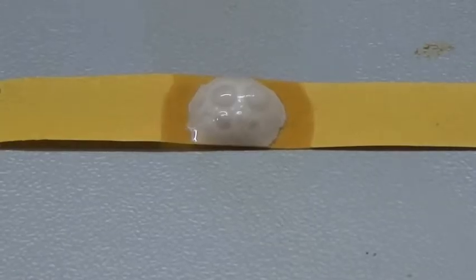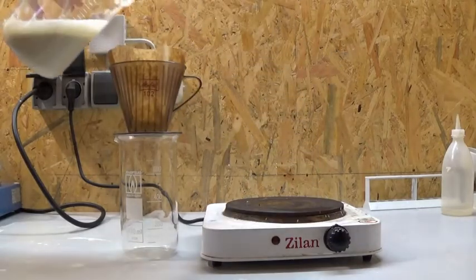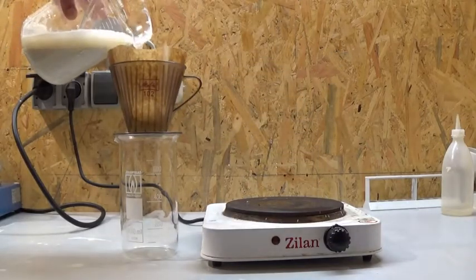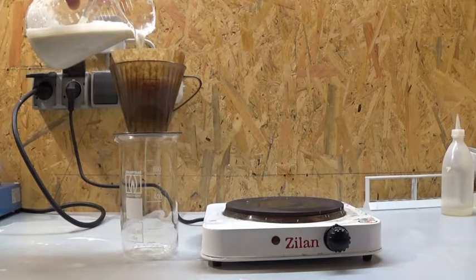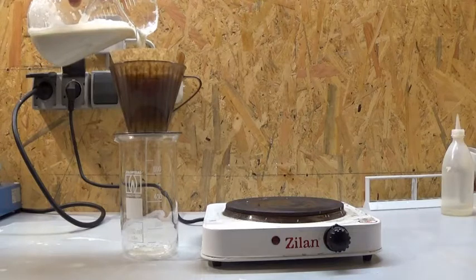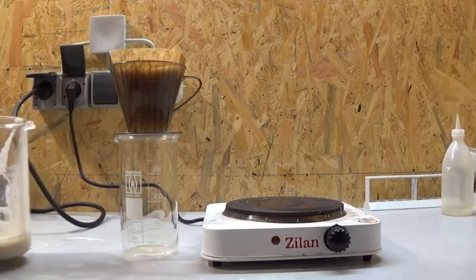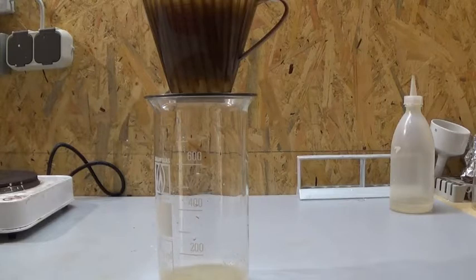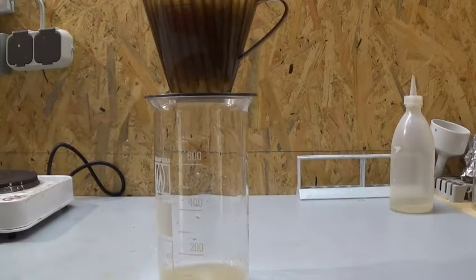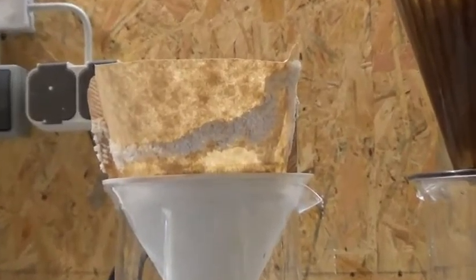To see if the reaction is finished, simply test the pH of the solution. If it is not acidic anymore, you are done adding carbonate. Now you have to filter the solution to get rid of any remaining calcium carbonate. During the filtration, some of the calcium acetate already crystallized out and formed nice big crystals on the outside of the filter paper. After filtering, all you have to do is reduce the filtrate and dry the obtained calcium acetate, but be careful because it decomposes at around 160 degrees C.